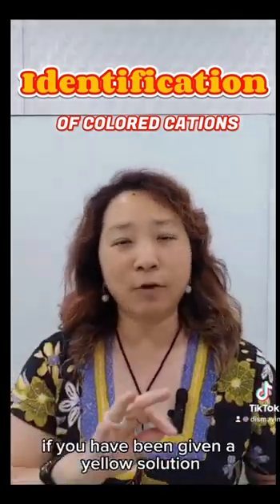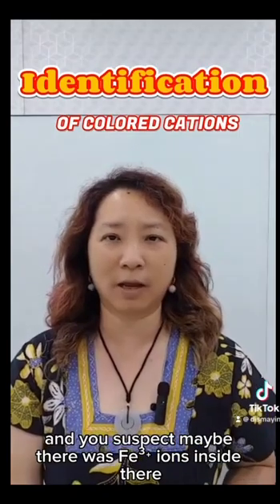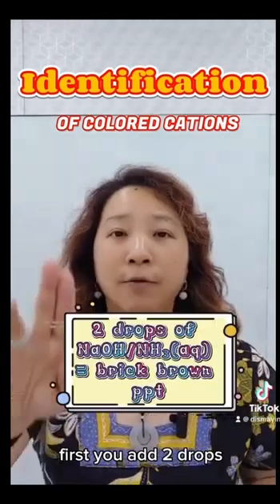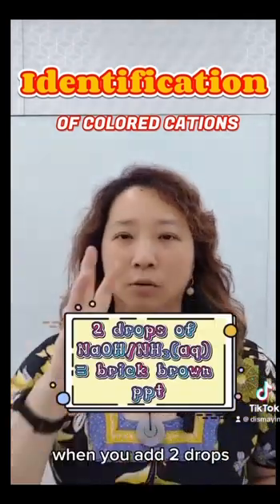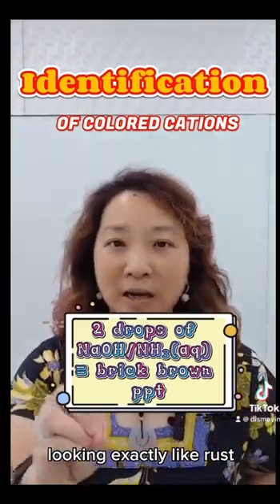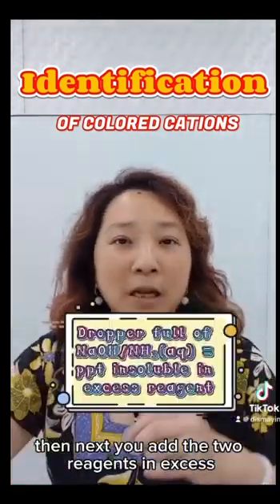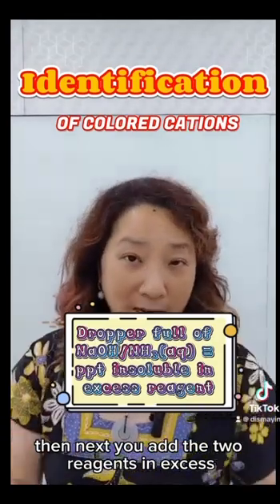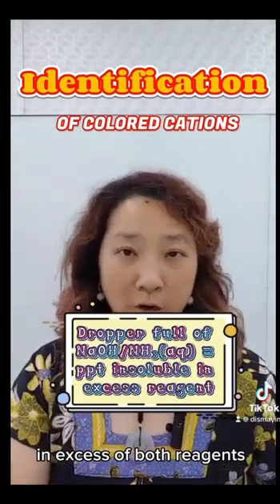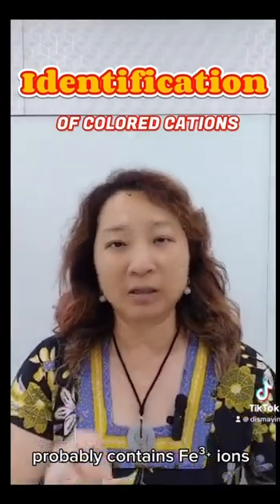Okay. Then thirdly, if you have been given a yellow solution and you suspect maybe that was iron 3 ions inside there, then what you do is, again, with the 2 reagents, sodium hydroxide and aqueous ammonia, first you add 2 drops, and for both reagents, you will notice the appearance and the production of red-brown PPT, looking exactly like rust. And in fact, if you take a whiff, it actually smells like rust as well. And next, you add the 2 reagents in excess, and you will find that the red-brown PPT is actually insoluble in excess of both reagents. Hence, you can conclude that the unknown solution probably contains iron 3 ions.